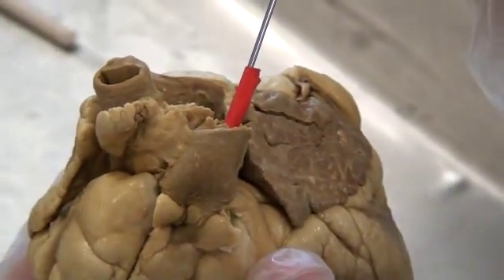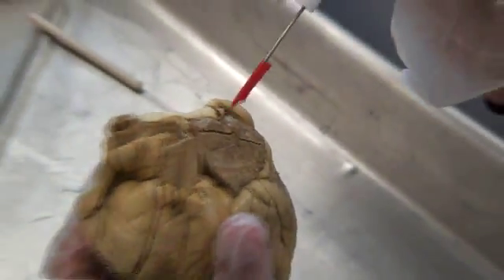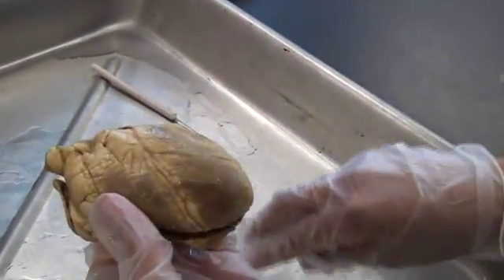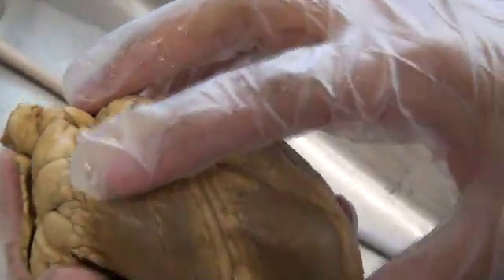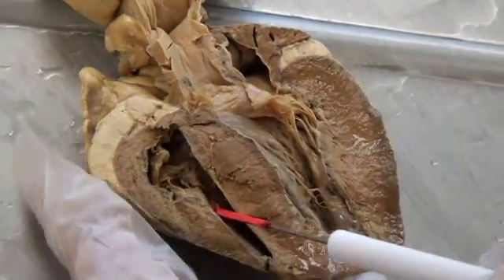Number five and six we're going to skip. Seven will be the atria — the left atria, which is right there. The right atria. The left ventricle, which is number eight, is right there. The right ventricle is right there.